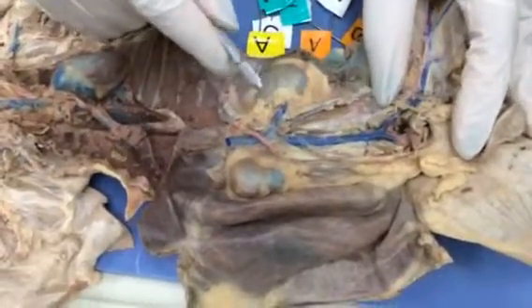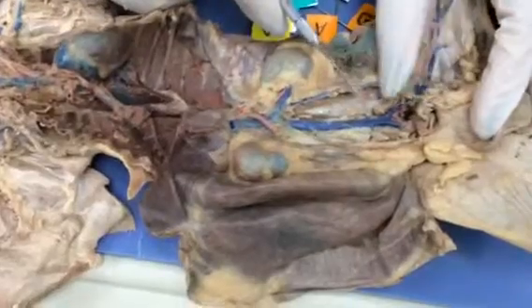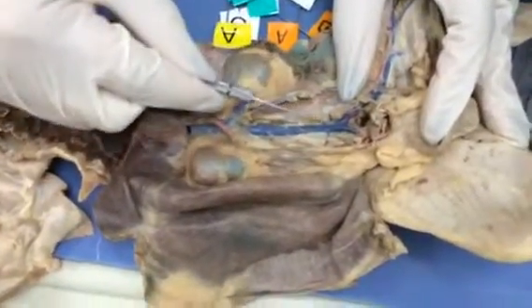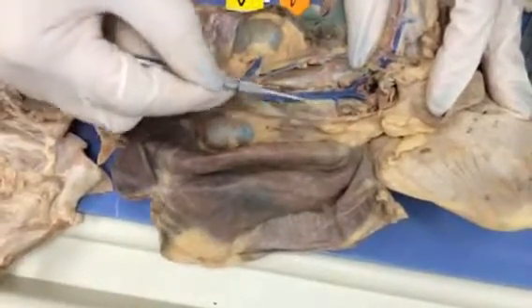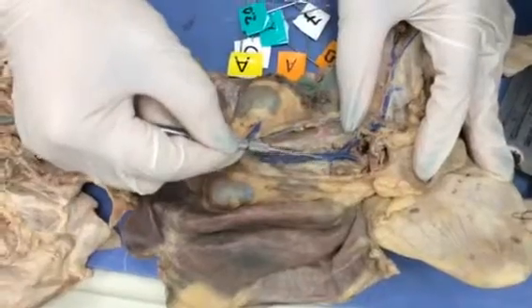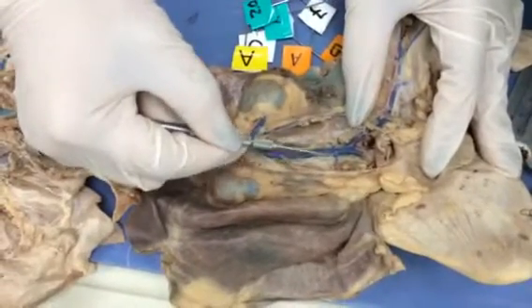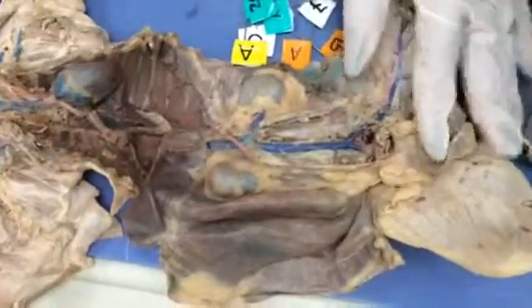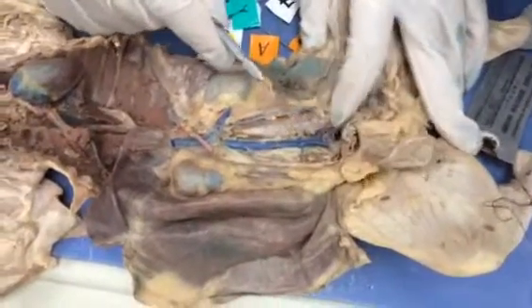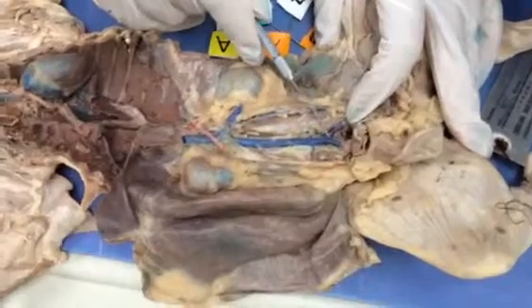Now we continue the journey, following the blood vessels into the lower back of the kidney. This is the iliolumbar, left and right. You see how it has a satellite. The artery has a satellite vein, iliolumbar, right and then left. It comes to a point where the inferior vena cava bifurcates and it turns into what we call the common iliac.